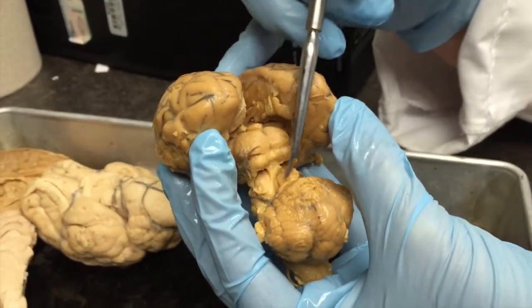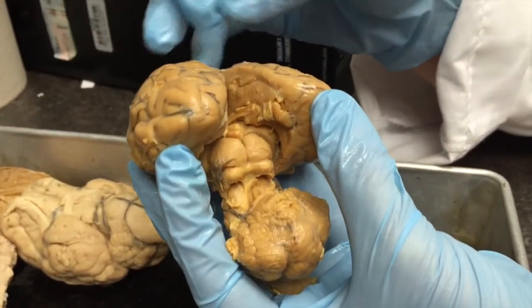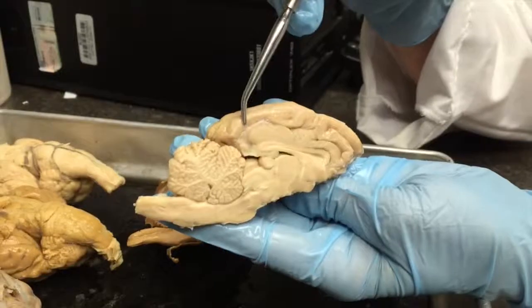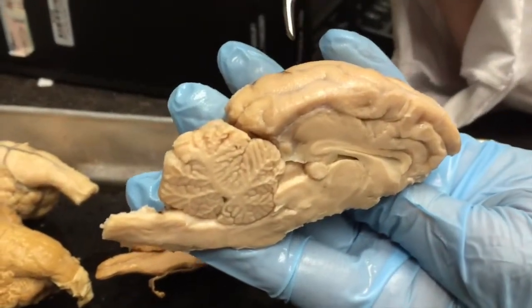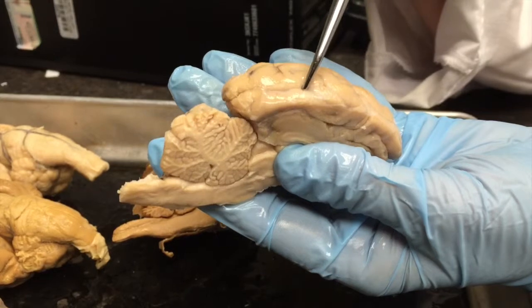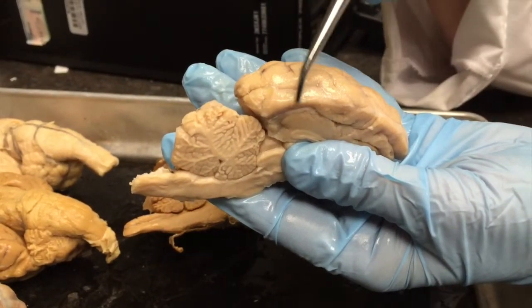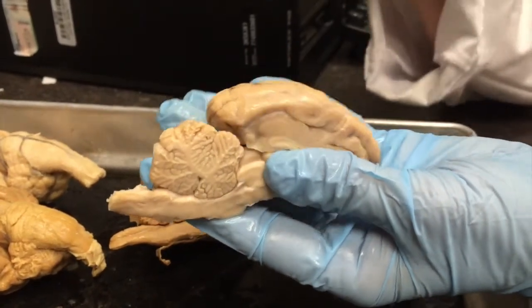Be really careful, because notice how the brainstem is kind of tearing here. You want to be careful that you don't break that off while you're looking at these structures. You can see the gyri here, the little ridges on the cerebrum. Because we have an arachnoid covering, I can't really stick my probe in there, but the sulcus would be the little shallow groove between the gyri. So the gyri are the ridges, and the little grooves are the sulci.